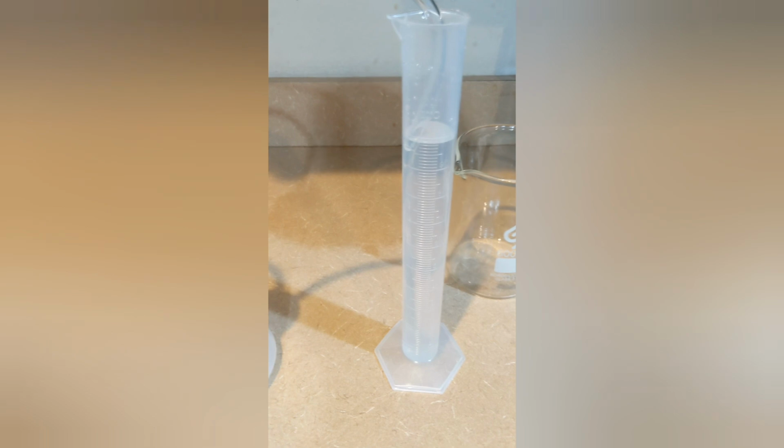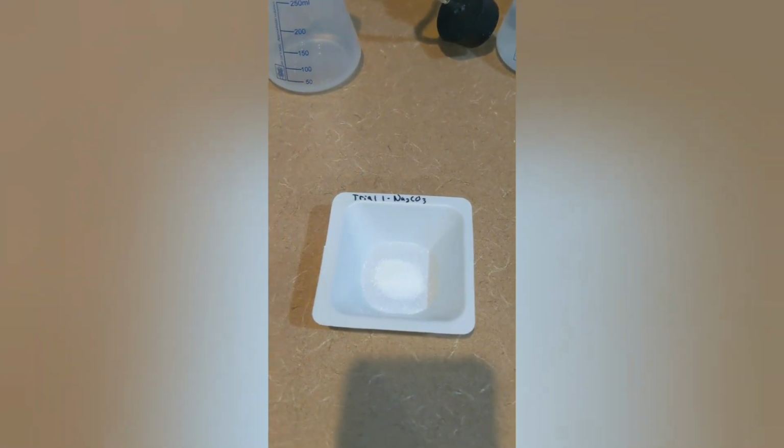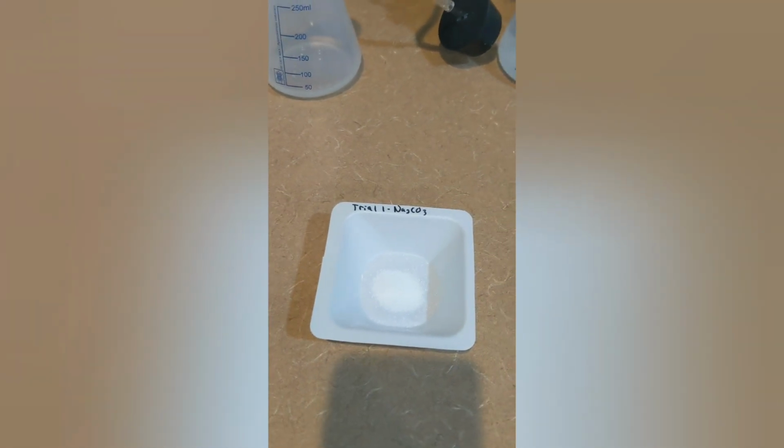Here are the results for the second trial for sodium bicarbonate, and the water was displaced at approximately 99 milliliters. Now I'm going to be doing the first trial with the sodium carbonate. So the results of the first trial for sodium carbonate are interesting because I didn't actually get any water in the graduated cylinder. I did see the reaction take place and the water began to go up through the rigid tubing, but then it reversed course and went back in. So hopefully I will get better results with the second trial.